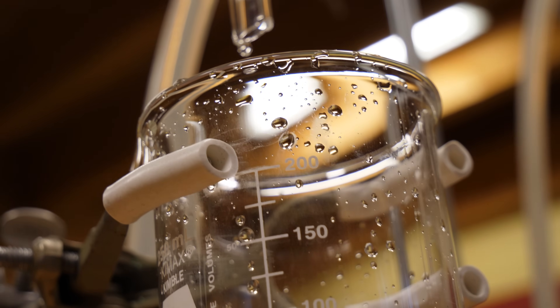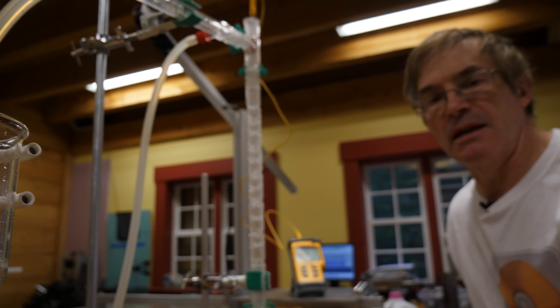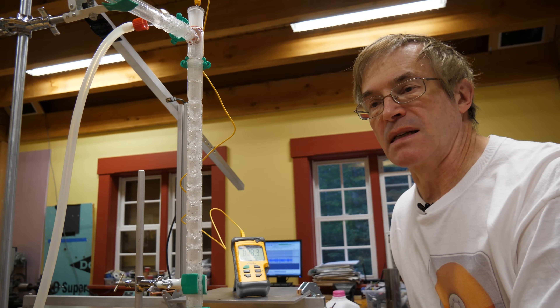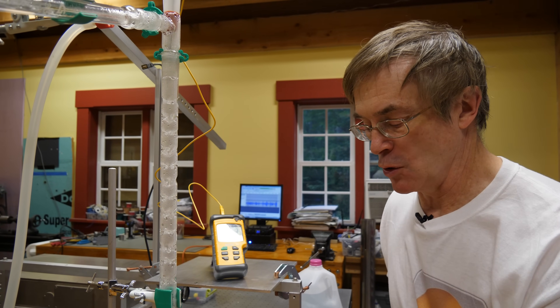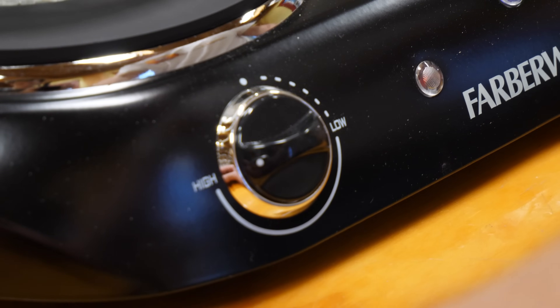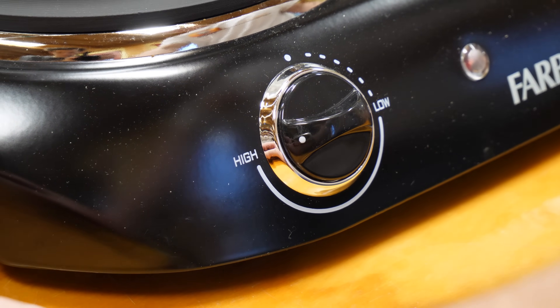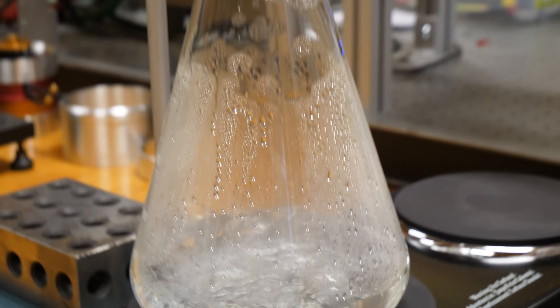Water is probably the most energetic liquid in terms of the energy required to break the intermolecular forces holding the molecules together. As a consequence, it takes a lot of heat to break those bonds. Therefore, even though we haven't changed the setting on the boiler, the boiling seems less vigorous and the flow into the collection cup is slower. We haven't changed anything about the heat — it just takes a lot more energy to boil water.